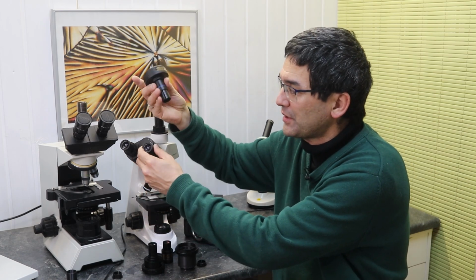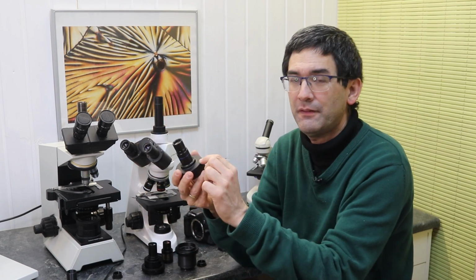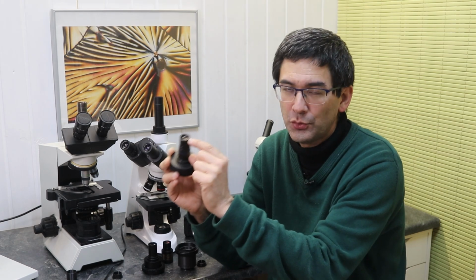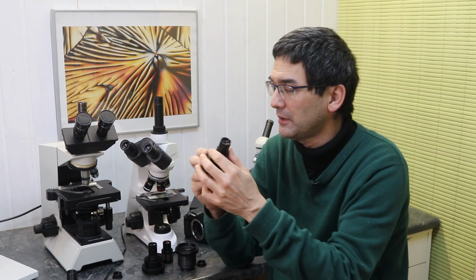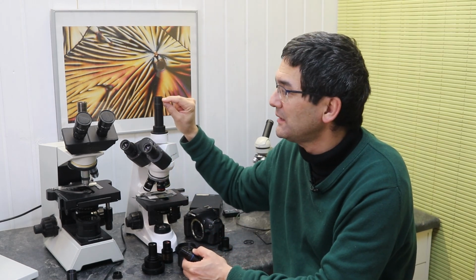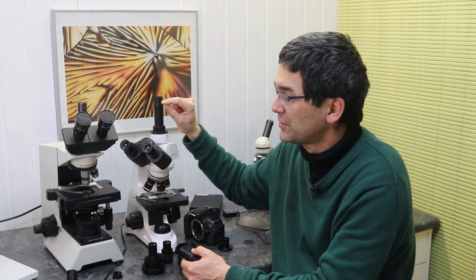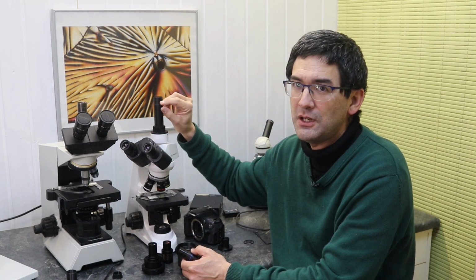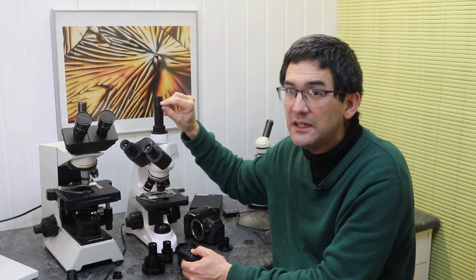And what those microscope cameras have is, of course, a sensor in here, and at the top there is optics, so-called reduction optics, and those reduction optics are pretty important because the microscope will create a picture approximately 1 centimeter down into the tube. So when it's in focus through the eyepiece, the image will also be projected here in the tube.